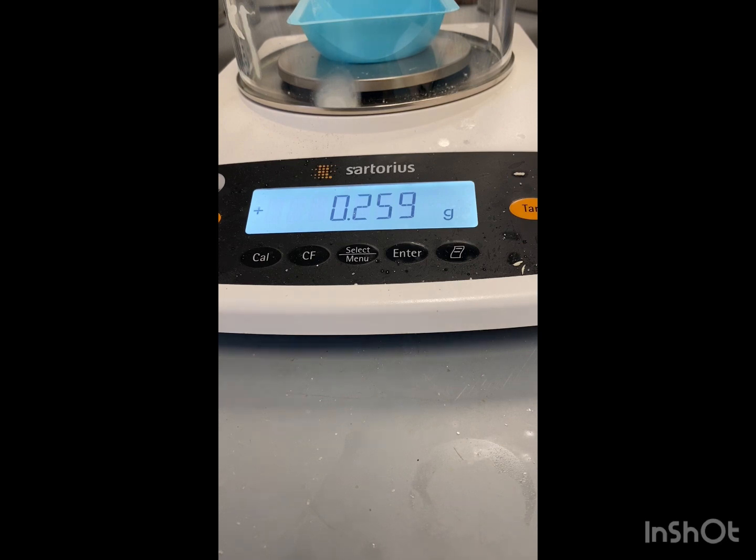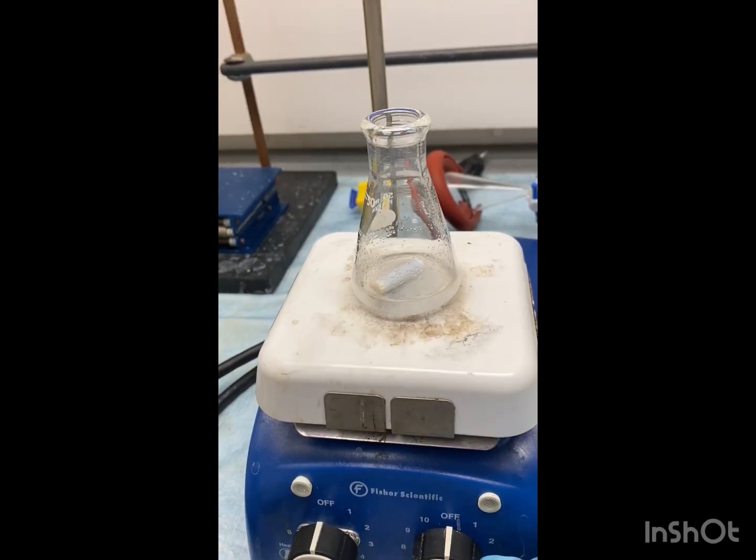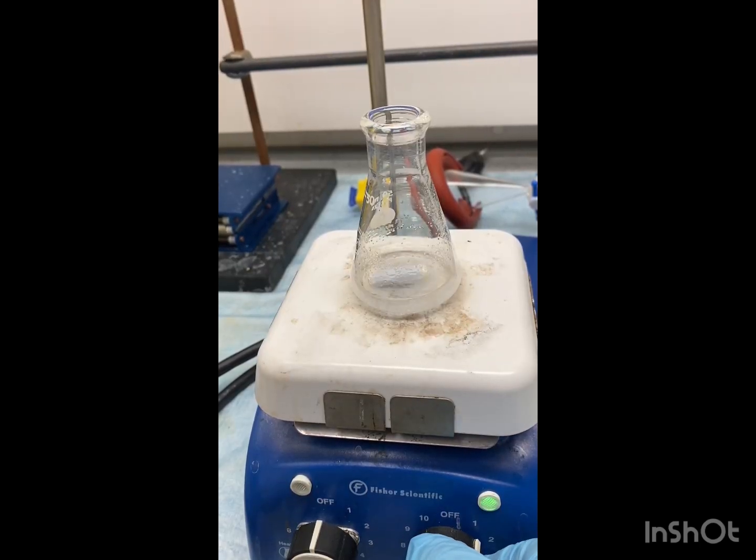And again, we're going to add that to our Erlenmeyer flask. Now we're going to gently heat with stirring.